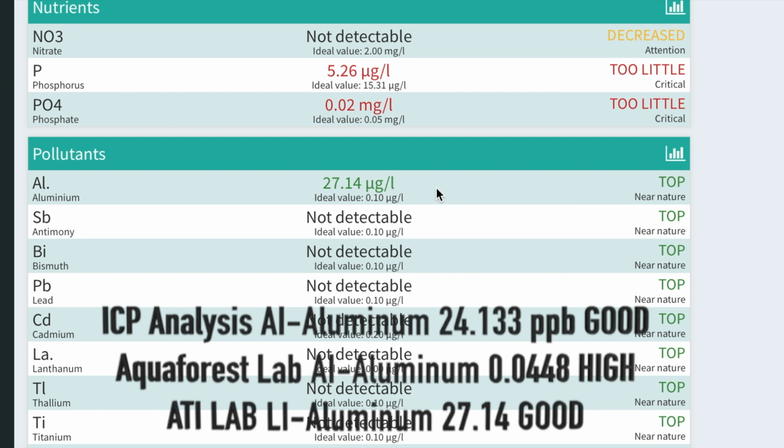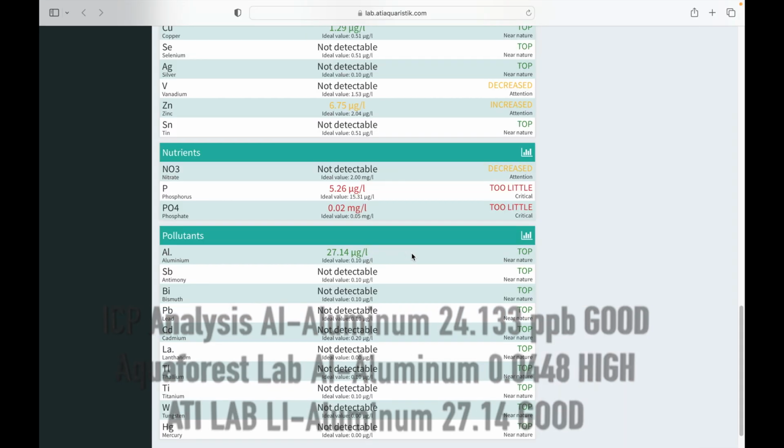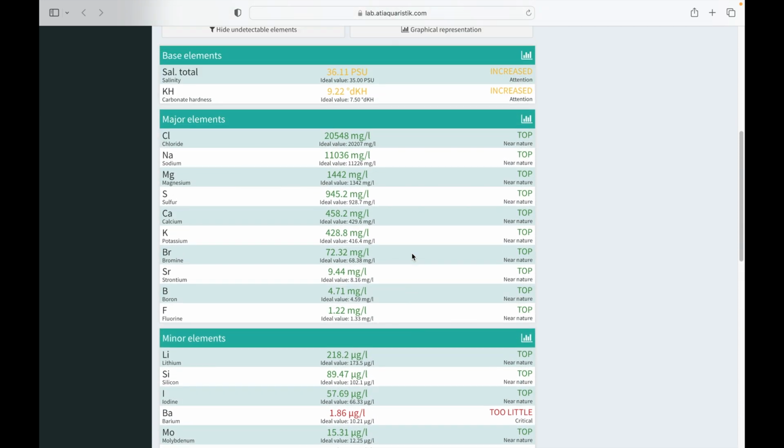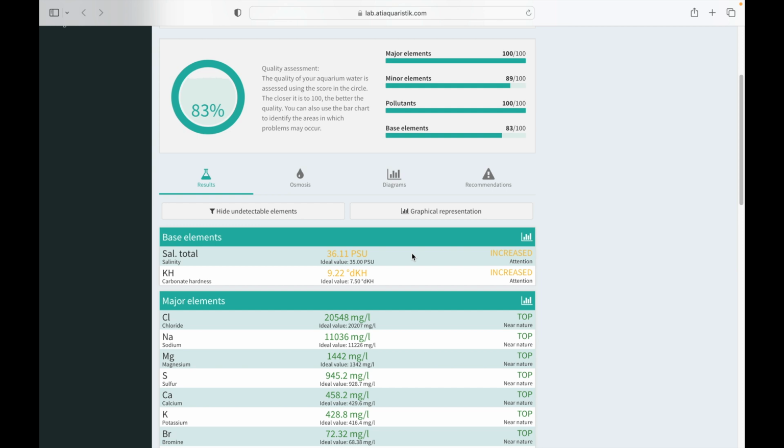And ICP Analysis said that it was normal. So 2 out of 3 said it's normal, but Aquaforest said that it's high. So I don't know. To me, that's just really unreliable. I just don't trust this now. I don't know what to say.